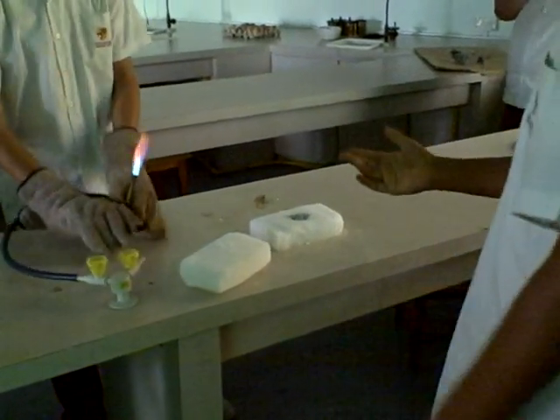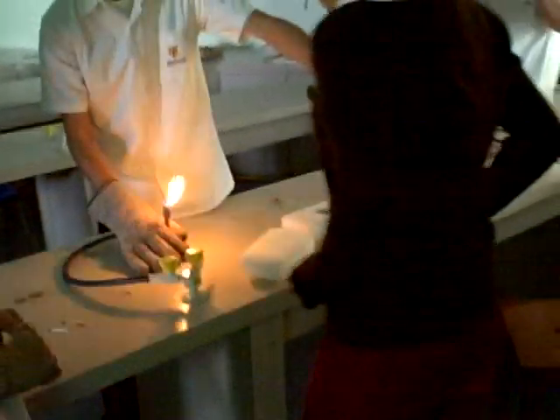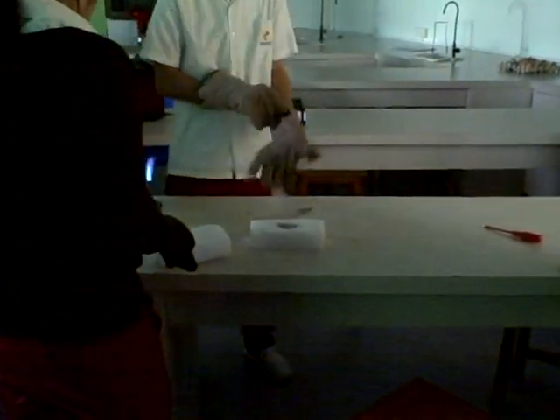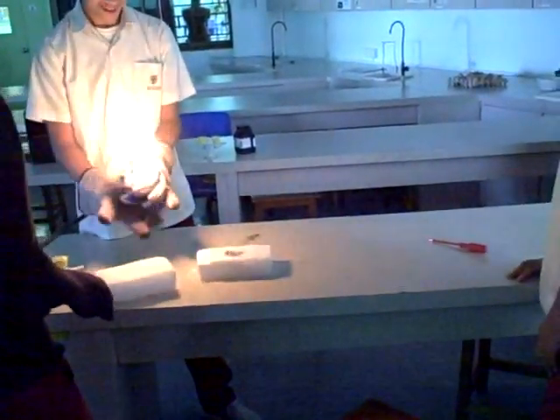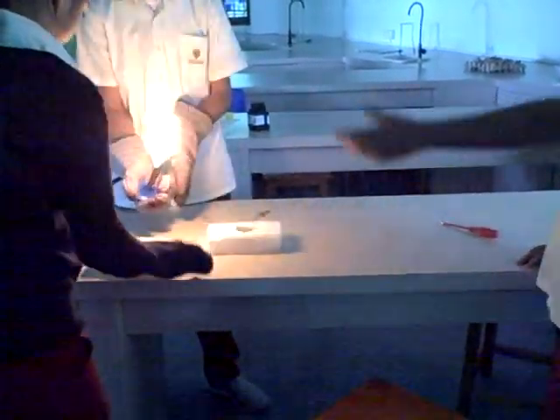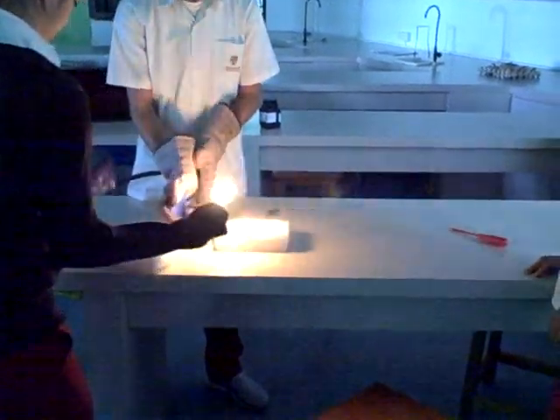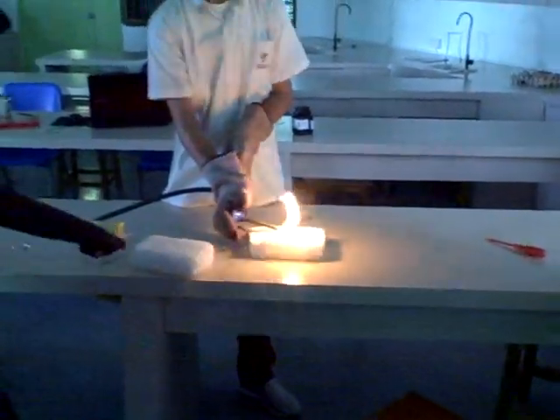Give me a glove back. She has the gloves; she's got the sweater on. Make sure you heat up the magnesium first. Emma, you need gloves — she's got her jacket. The jacket didn't burn; the gloves didn't either. Maxim, you don't need gloves with a Bunsen burner.